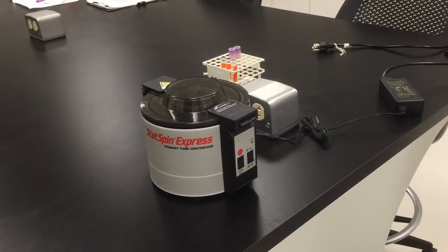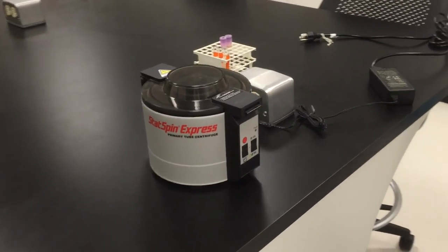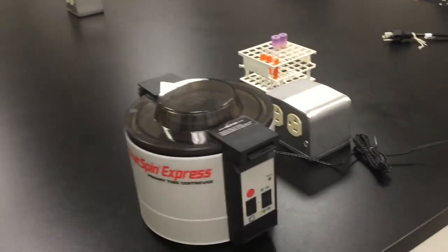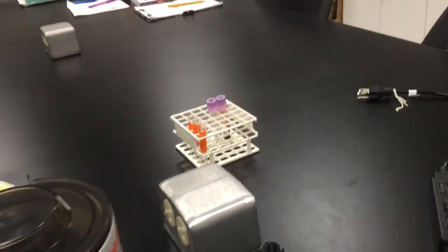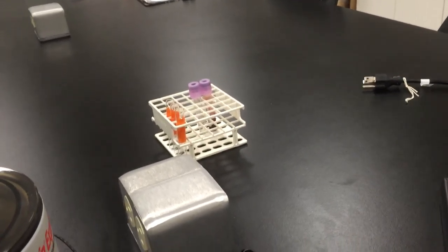All right, so today we're going to talk about centrifuge operations. This is a centrifuge and this is where your test tubes will be for you to do the centrifuge.